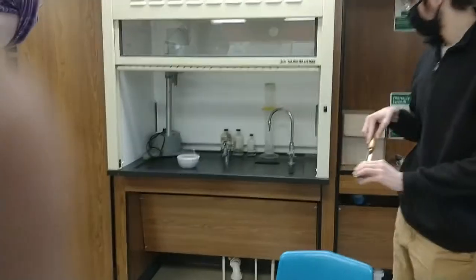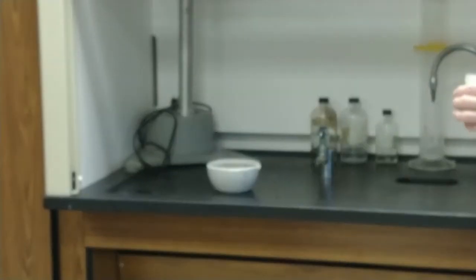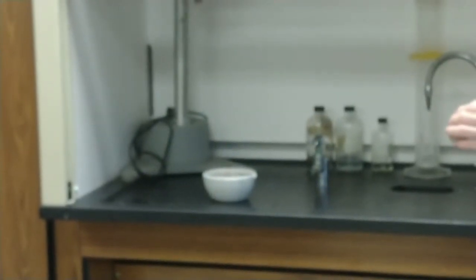Potassium permanganate, which we add in - we're supposed to add in 0.5 grams, but we're not exactly measuring it precisely.